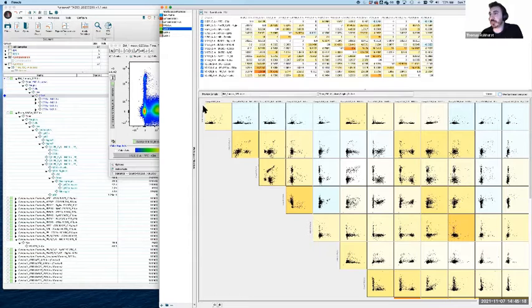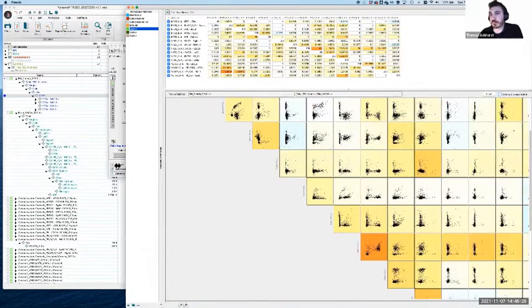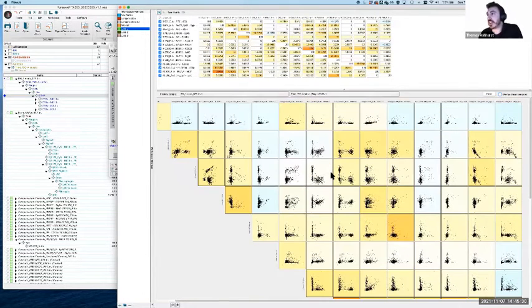So this is basically a matrix of every fluorophore, every detector pair. And we can explore each of these combinations and go hunting for where there looks like there might be problems. Now, the problems are that leaning that we were talking about before, that classic curve. What we're going to find here is there are going to be some problems, because I know there are problems because I made problems. There will be some areas which we might flag early on, and then we discover actually that's totally fine, or it's spreading error, we can't do anything about it. So we'll go hunting and see what we come across.